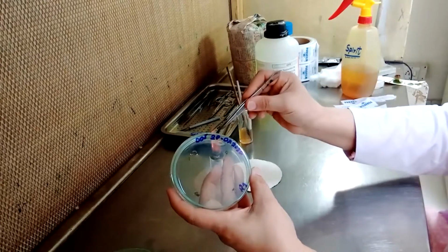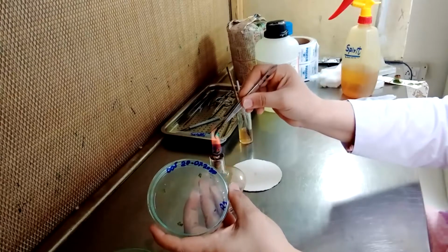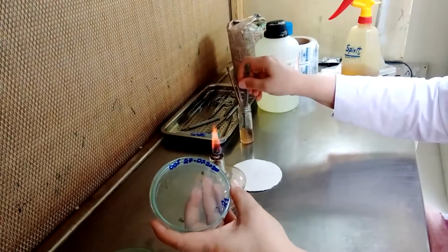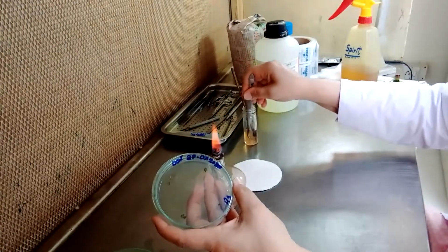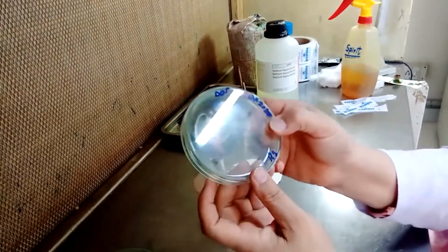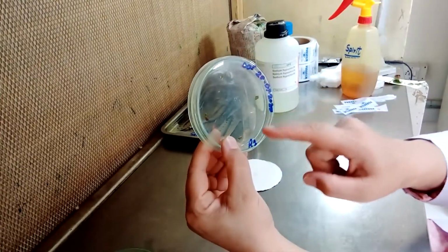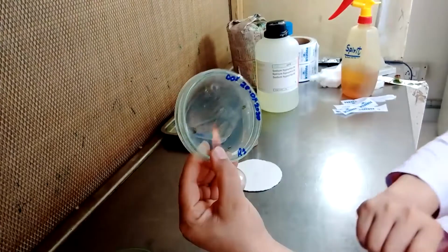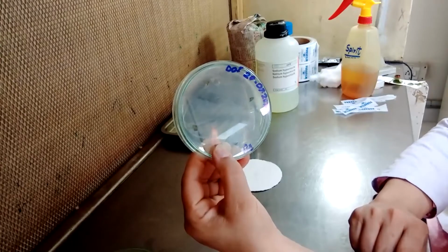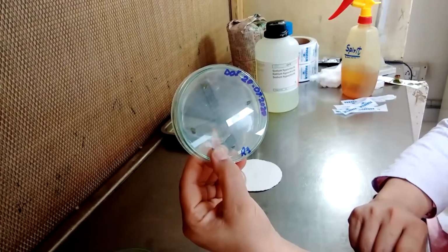So before putting it back, sterilize it, give it a dipping, and place it in the tool tray. So this is how you placed 4 specimens. You can place 4 specimens at a time for the isolation of the deep-seated pathogen in the sample, which is the cause of the disease.